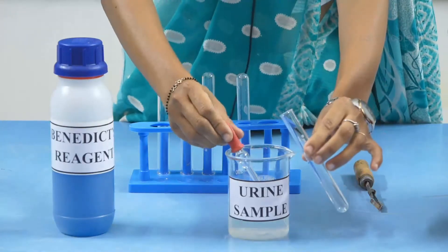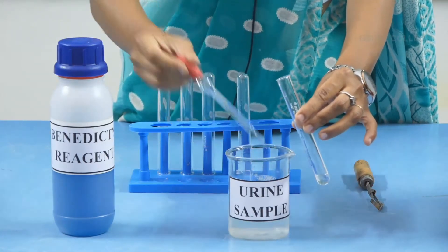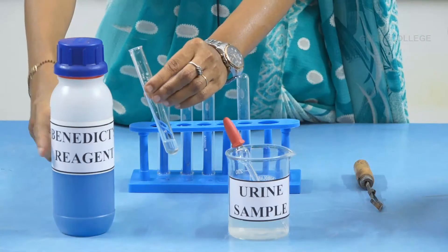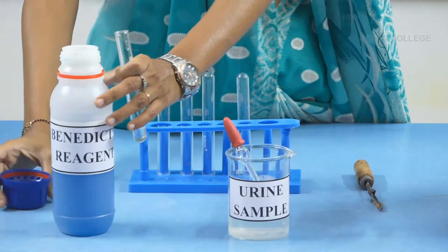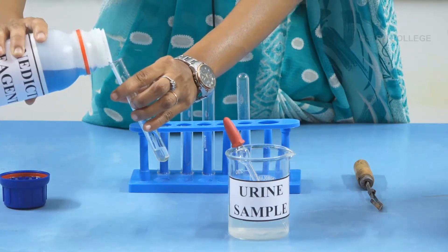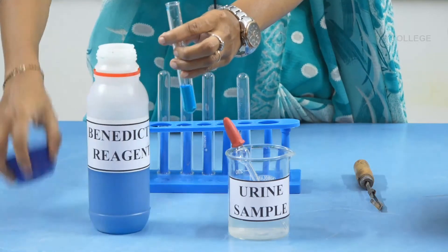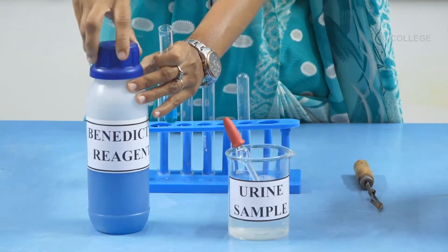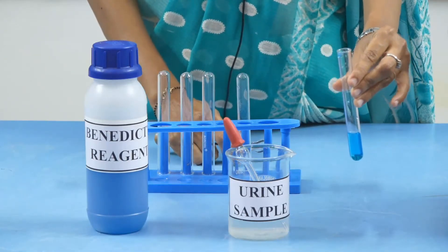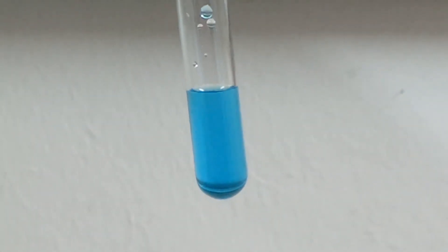Take a clean test tube and add a few drops of urine sample. Then add Benedict's reagent to this test tube. When you add the Benedict's reagent to the urine sample, the test tube will show blue colour.